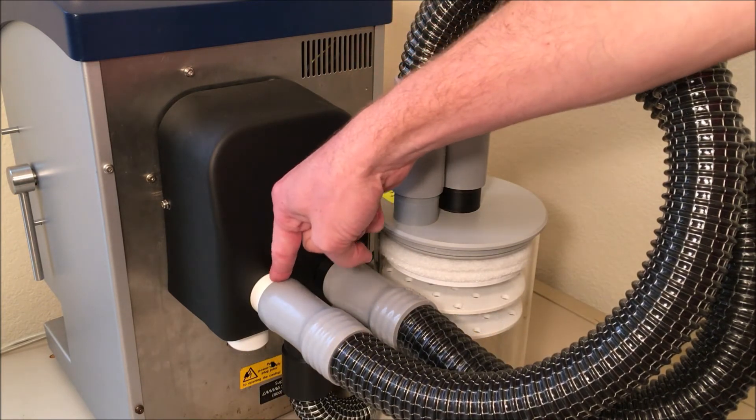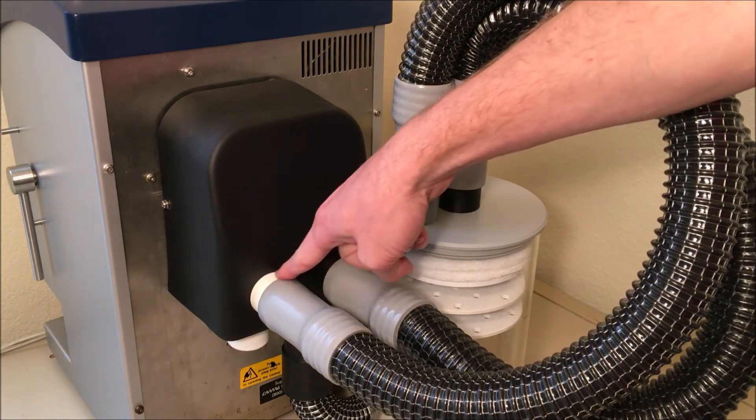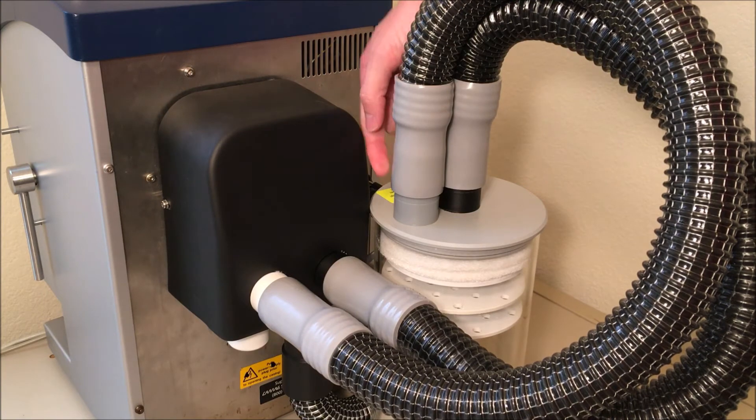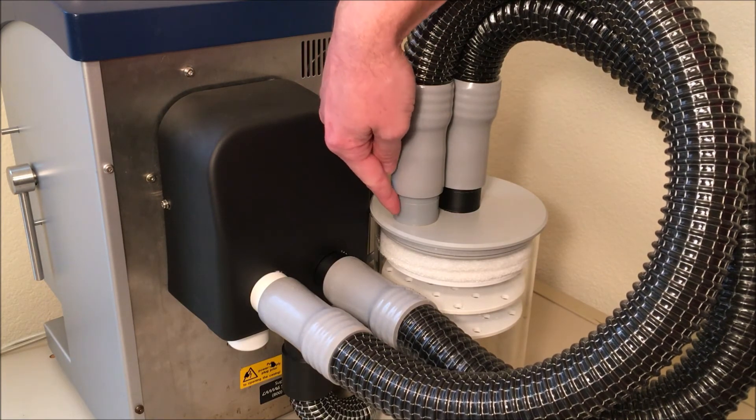So we connect the left tube which is the white or grey connection all the way to the container for the magnesium chloride and that would be either white or grey.